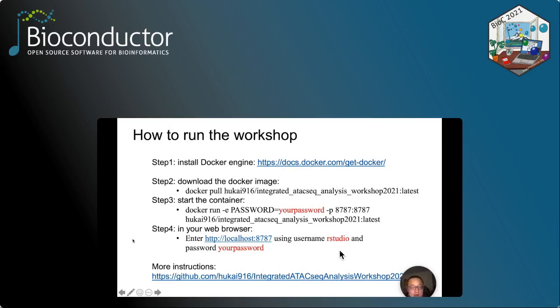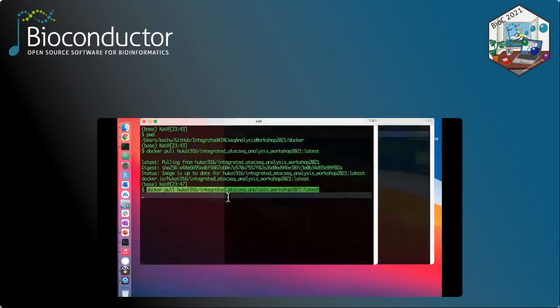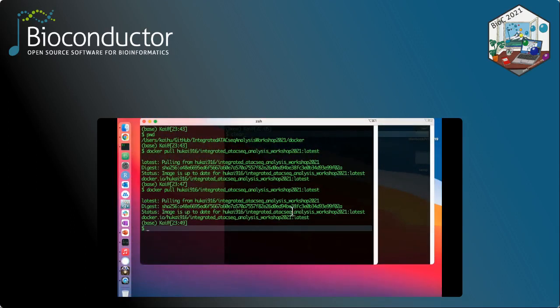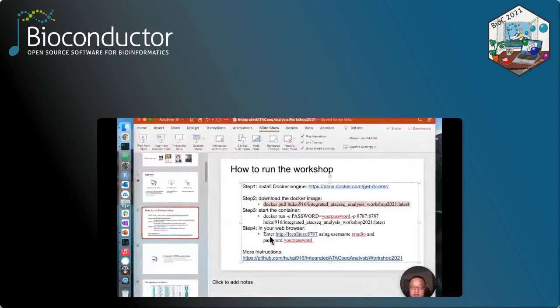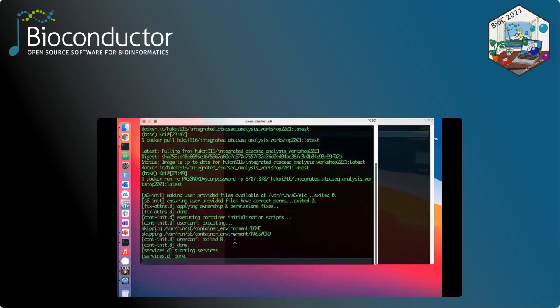And now I'm going to briefly show you how to run those codes. So basically, the first thing you have to do is to copy and paste this docker pull command and type it into your terminal. This command will download the image from the Docker Hub. Depending on the speed of your internet, it will take 10 to 30 minutes to download for the first time. And after that, you must initiate the Docker image with the docker run command. And this will start the container.